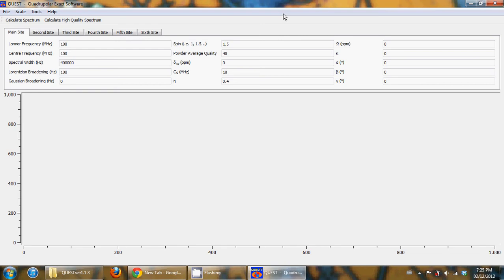But for most cases, there's actually no intensity in that particular bin for any of the 3 frequencies that you're interpolating from. And so if you just filter out all these cases where you basically add 0, then you speed up by about a factor of 10. So the newest version of Quest is significantly faster.